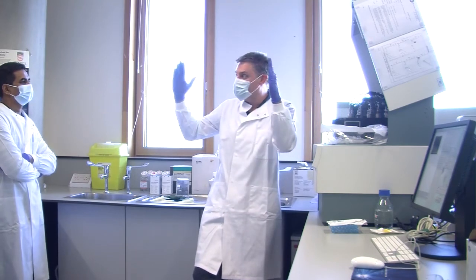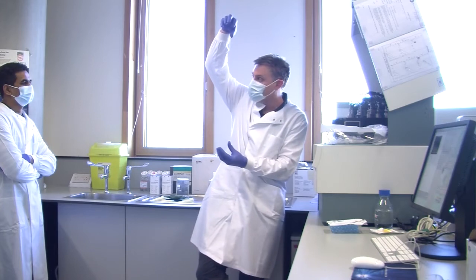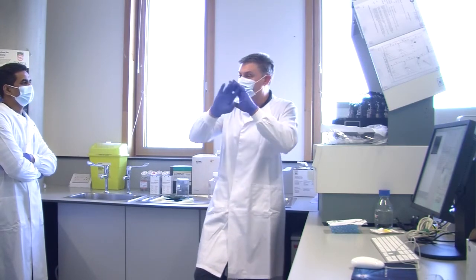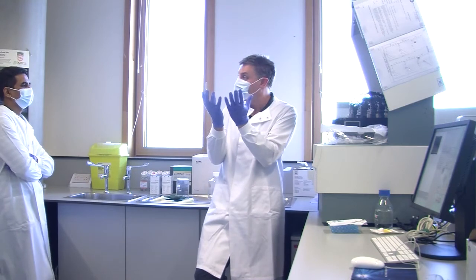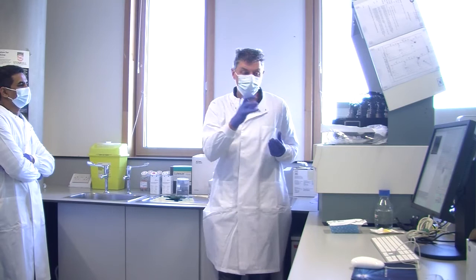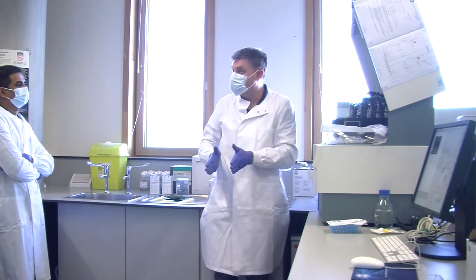And it all gets squashed together as it goes through the V, until it gets to a very, very narrow bit at the top. And then it goes through a sort of straight chamber. Because everything's been squeezed, your sample has been squashed down to about 10 microns wide, and it's surrounded by a column of sheath fluid. That's why it's called sheath fluid, because it forms a sheath all around it. So we've got a stream of cells 10 microns wide. Because your cells are around 8 to 10 microns, you've got one cell, and then another cell, and then another cell, and another cell, going through that narrow chamber.